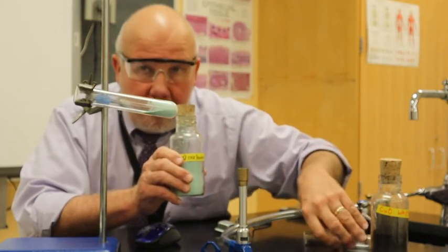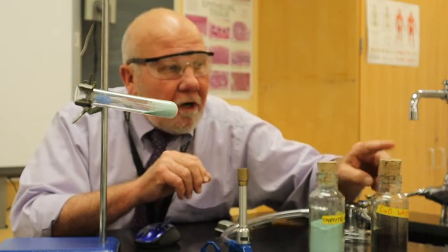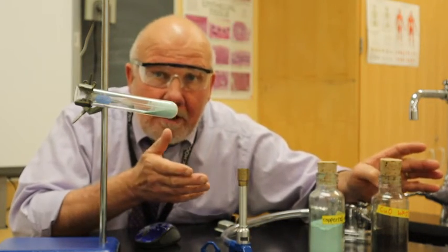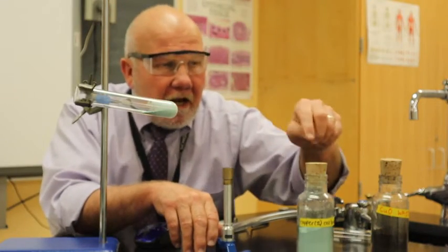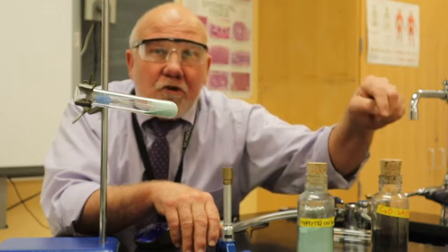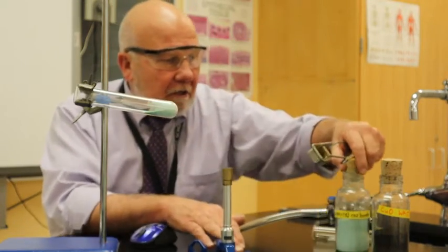All right, which we want to produce copper oxide. It's used in the semiconductor industry, so we want to make product. So by heating this up, decomposing it at high temperature, it'll break down and form copper oxide and carbon dioxide, which will go off into the air. So I'm going to light the lab burner.